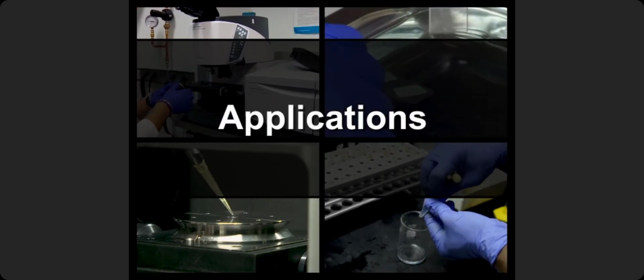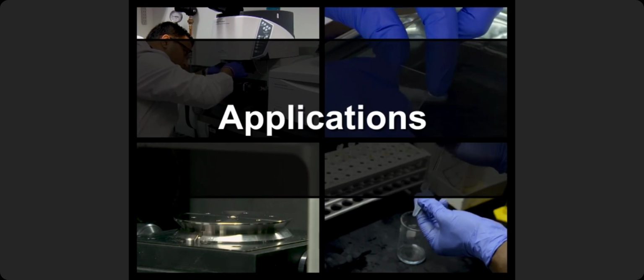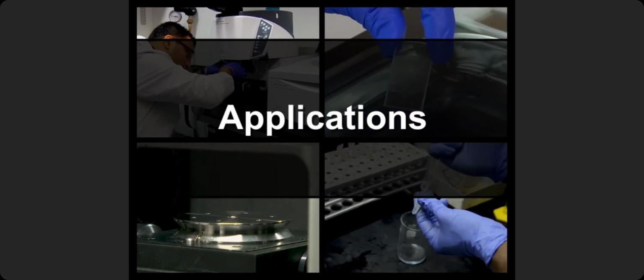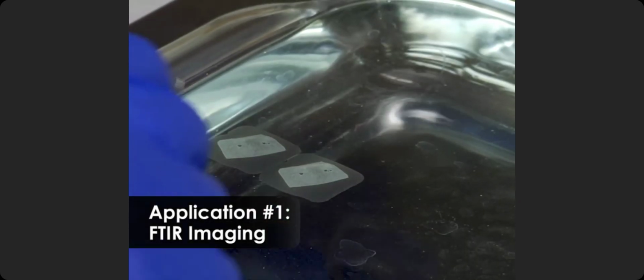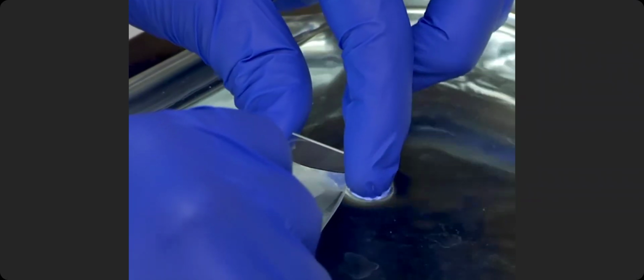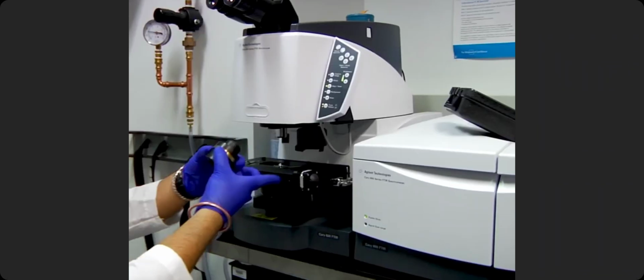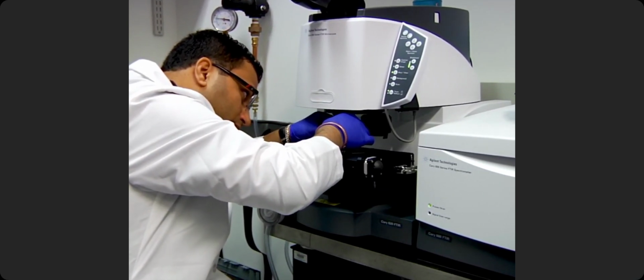IR spectrophotometry is a widely used characterization tool in biology and chemistry. Let's look at a few examples. In this procedure, FTIR spectroscopy performed with the ATR method was used to obtain IR absorbance images of tissue by introducing a microscopy component into the instrument.